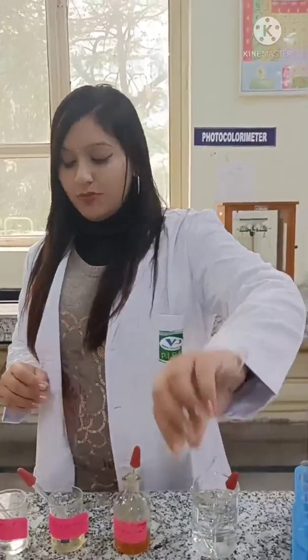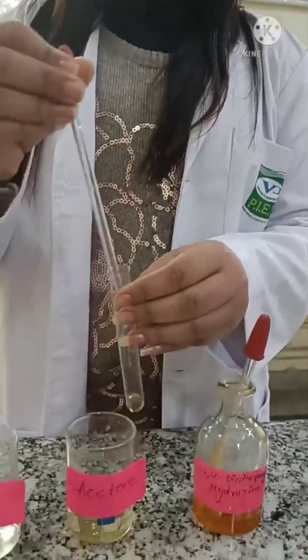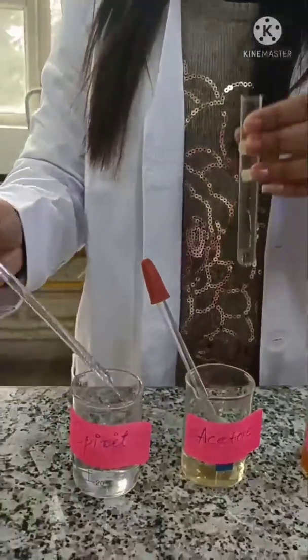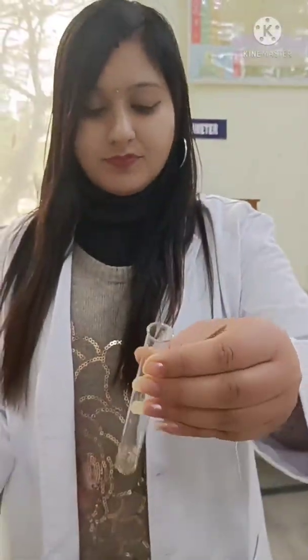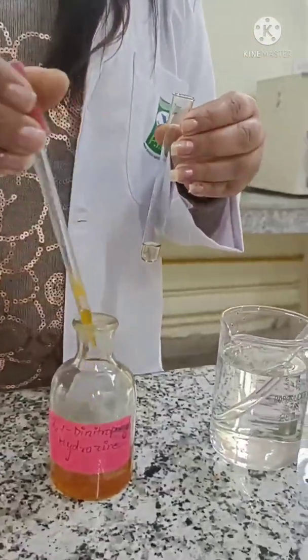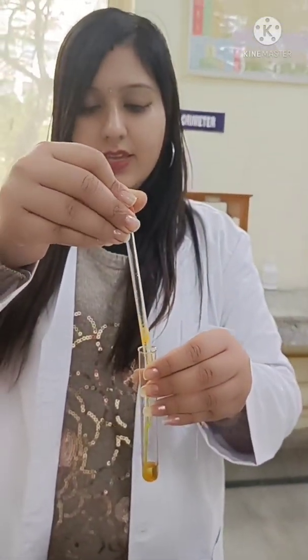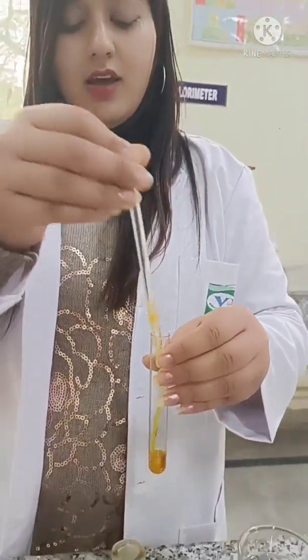Take a test tube. Add a few drops of the organic compound acetone, then dissolve it in spirit by adding a few drops of spirit.